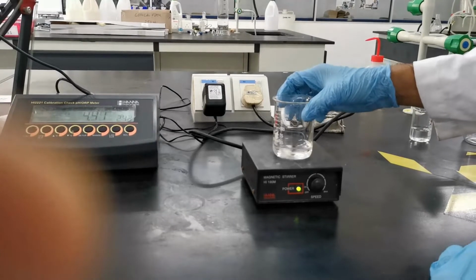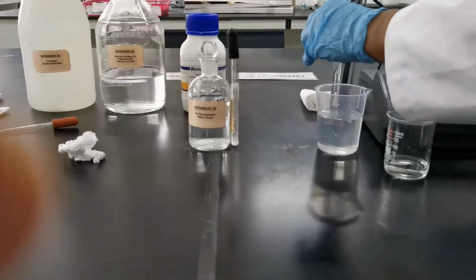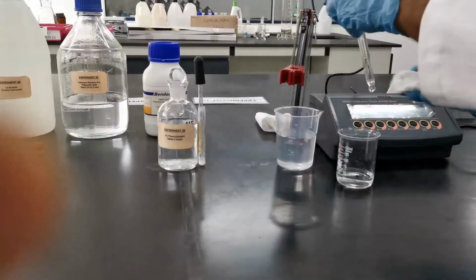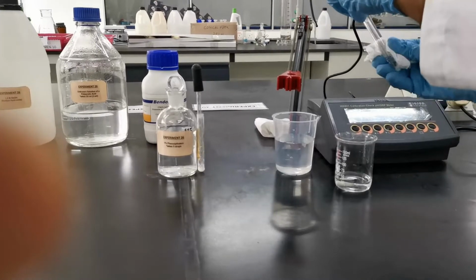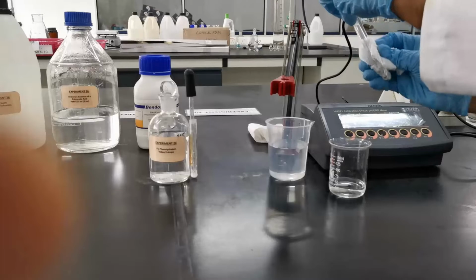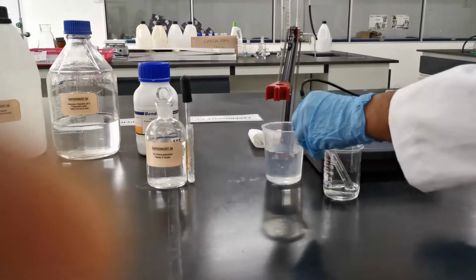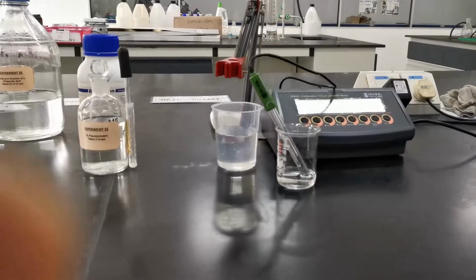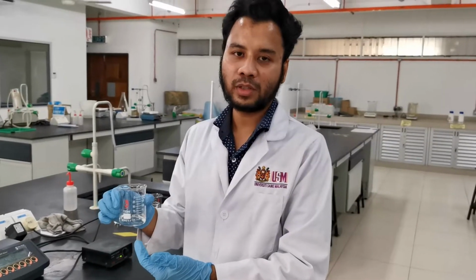Once you finish with the magnetic stirring, the next step is to measure the pH of the solution. Make sure you wipe the bulb of the electrode and make sure it is clean, immerse it fully, and then wait until you get a stable pH reading. We have added 2 ml of sodium hydroxide solution into the unknown polyprotic acid.